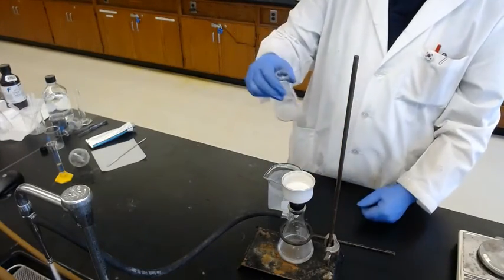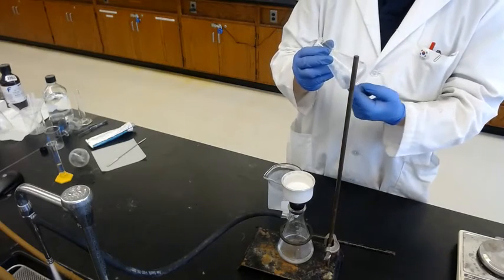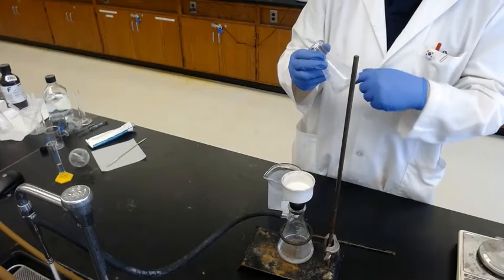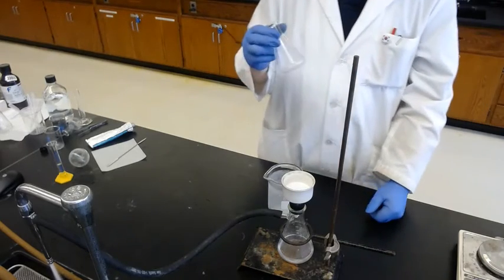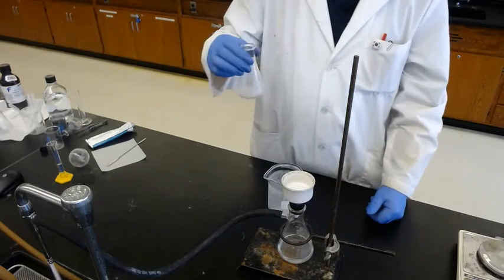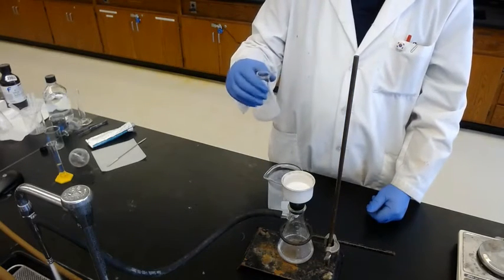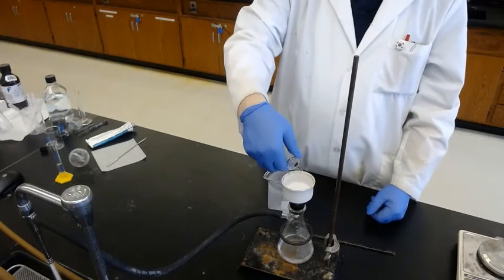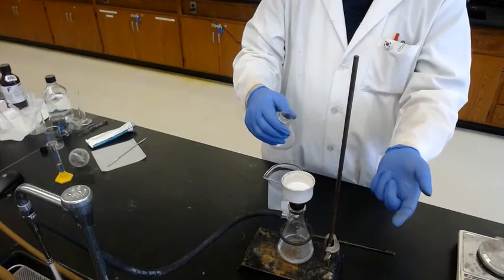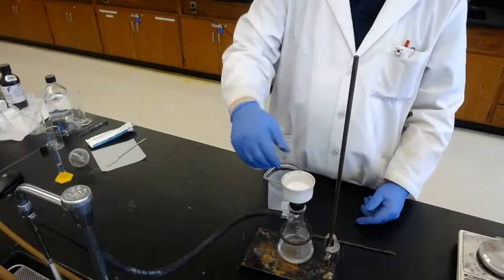If you transfer slowly, a lot of solid remains inside the flask, so you have to add another solvent and transfer. So maybe during the process you will lose your product. So remember, take it out from the ice bath, rolling it, quick and gentle. Don't go too quick. If you go too quick, it just splashes, so you're losing your product. So gentle but quick.